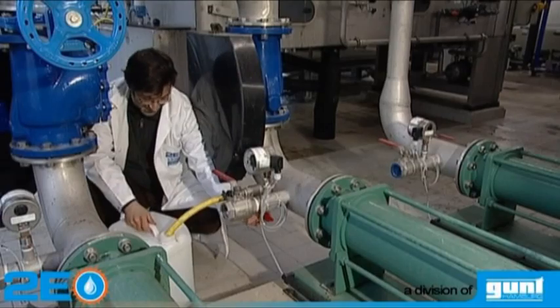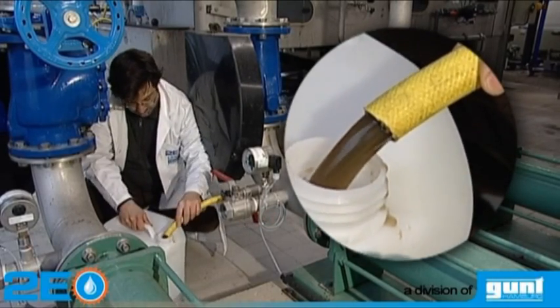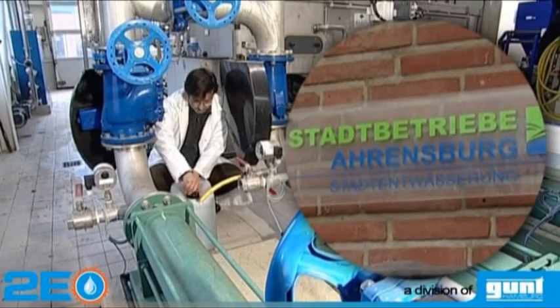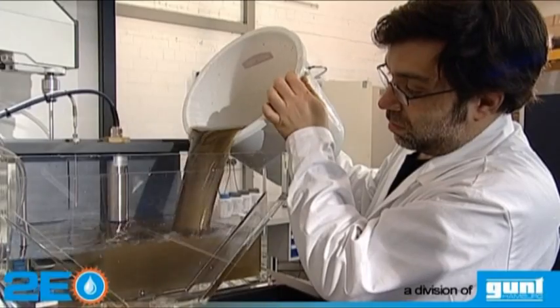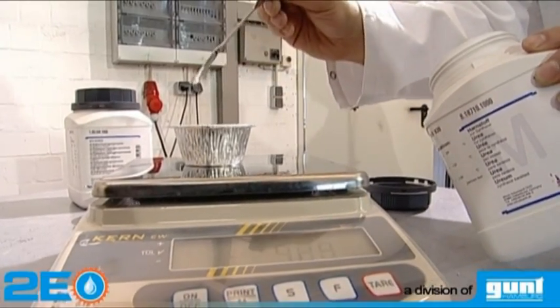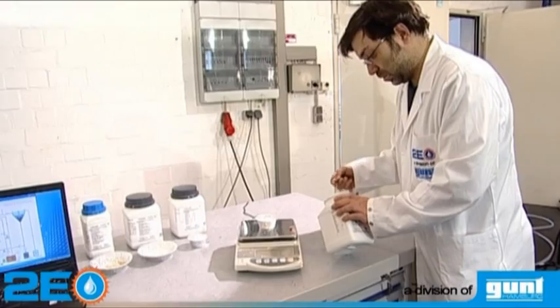The main component of this process is the activated sludge, which is an accumulation of microorganisms. To prepare the experiments, activated sludge has to be taken from a domestic wastewater treatment plant and filled into the aeration tank of the CE705. Artificial wastewater is prepared in the laboratory to simulate average contaminated domestic wastewater.